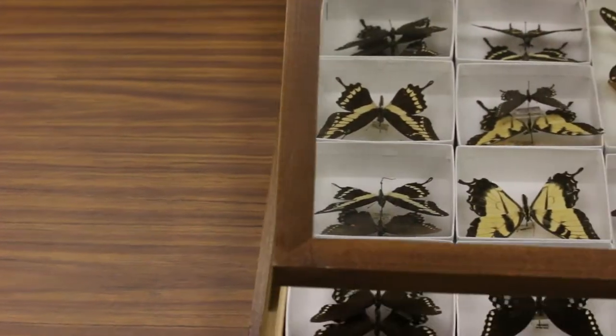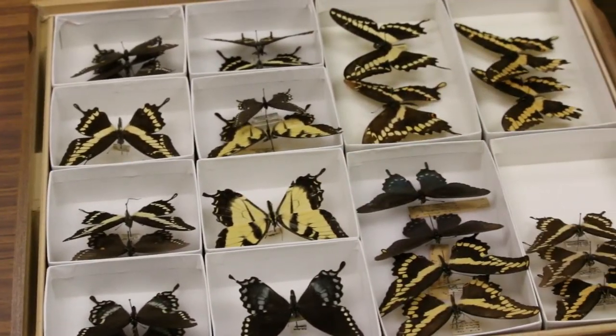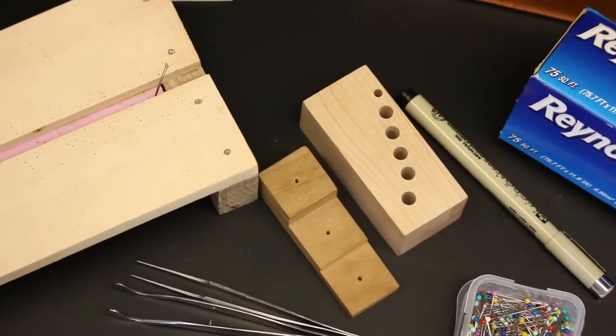I'm going to show you how to spread a butterfly, but first you need to know some of the supplies that we'll be using.